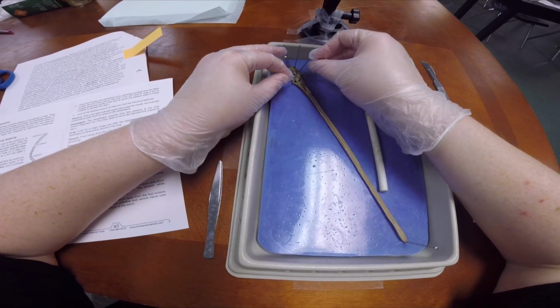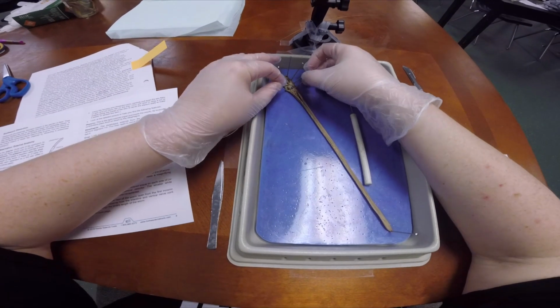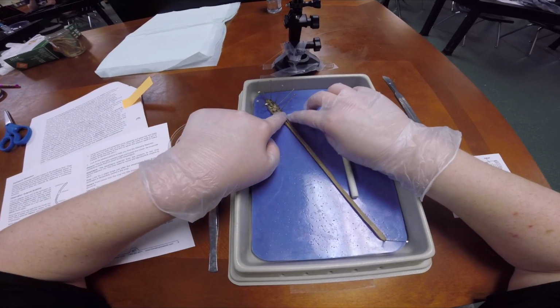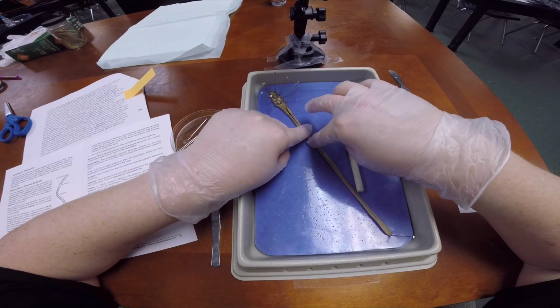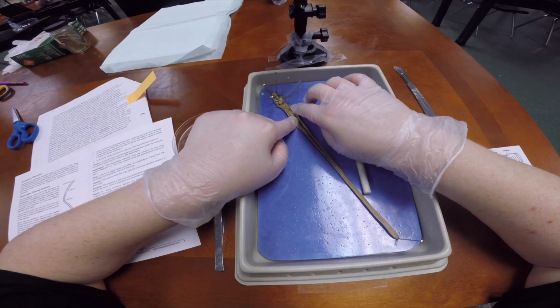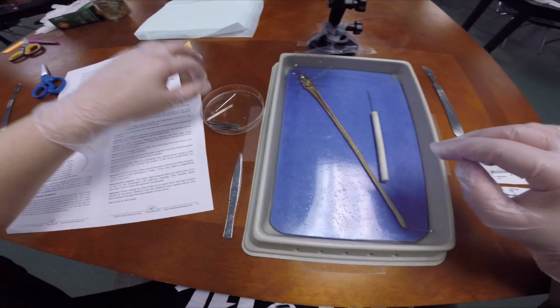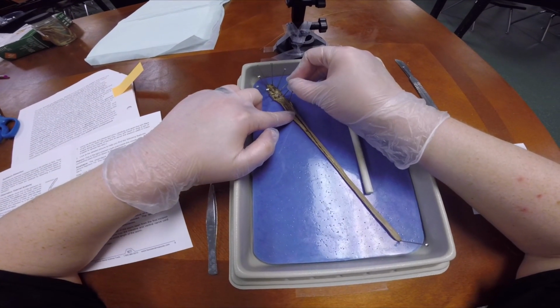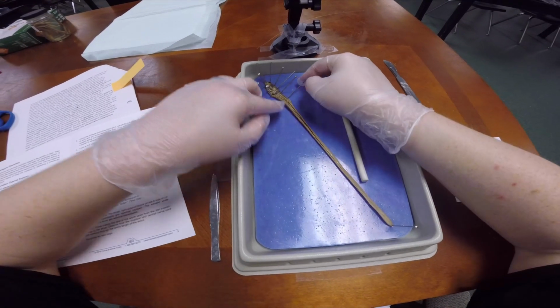So we're just going to pin him from the mouth to the clitellum, because from the clitellum down is just the extra dirt and stuff that's going to go out of the posterior. So once you see one part of that, you can kind of imagine what the whole part looks like.